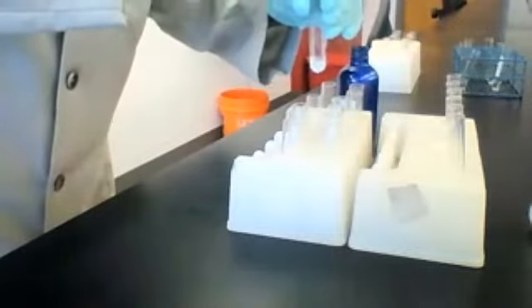Continuing to react with silver nitrate. Our next test solution is sodium carbonate, Na2CO3. Now it was clear and colorless, but hopefully you can see as I add more AgNO3, it's changing color. And this is what the mixture looks like. Again, how do we describe that?